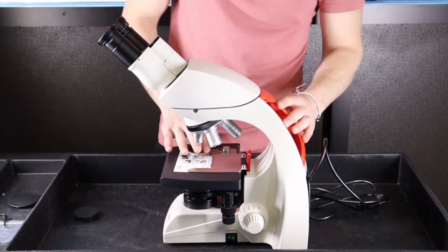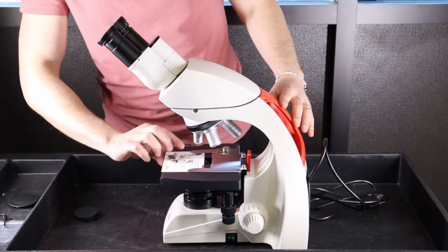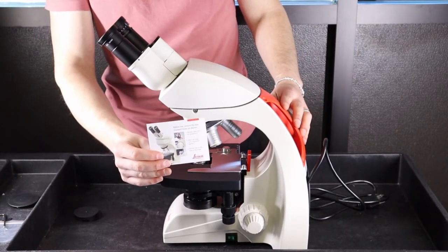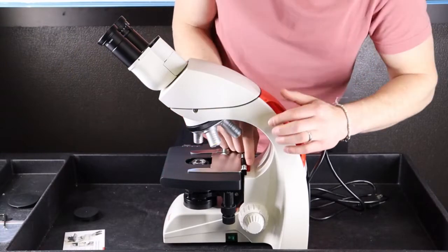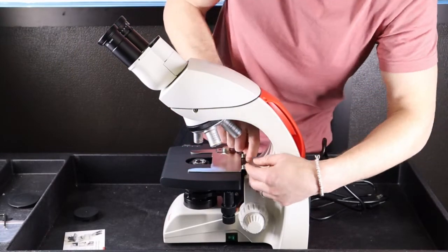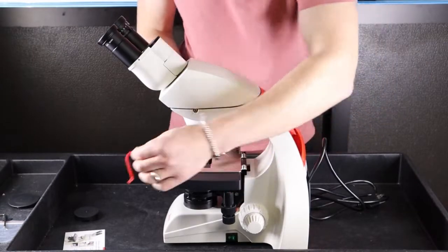There are a few shipping locks to remove. This card will demonstrate where they are. You'll remove that card. You'll pinch and squeeze and remove this lock up top.